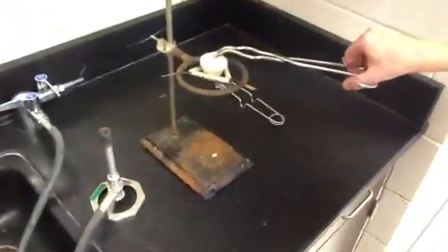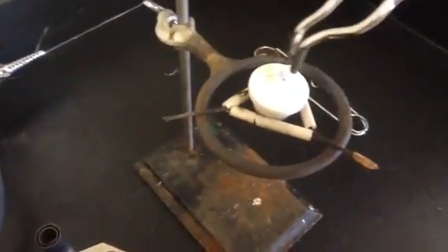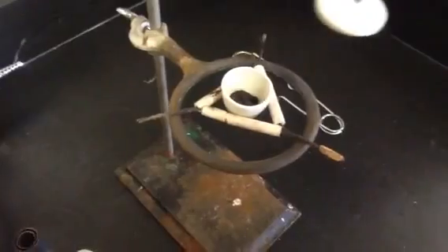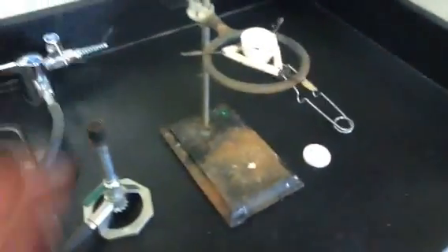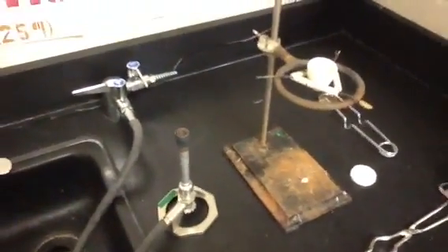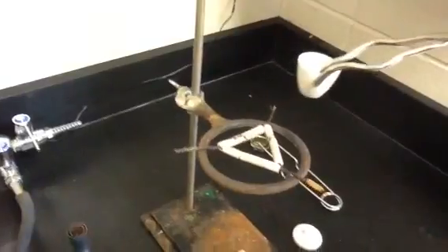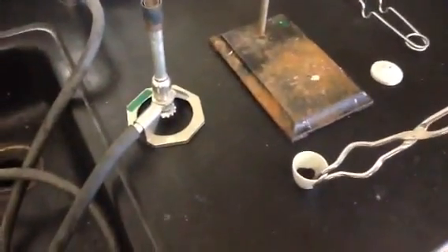We're going to take off the top of the crucible. You can look in there. How do you grab it, Connor? You grab it perpendicular — that little tab there, that's what you want to grab. It's looking pretty cool — looking hot, very hot. We're going to let it cool for a little bit. You have to take it off the clay triangle. Grab it by just one side like that and set it right on the table. Don't spill it. You don't want to touch it — make sure it cools off. Let it cool for a good minute or so.